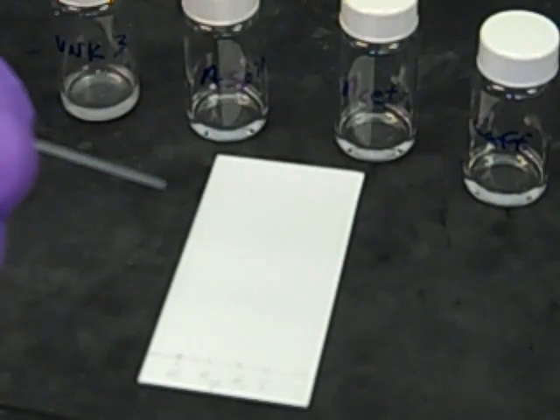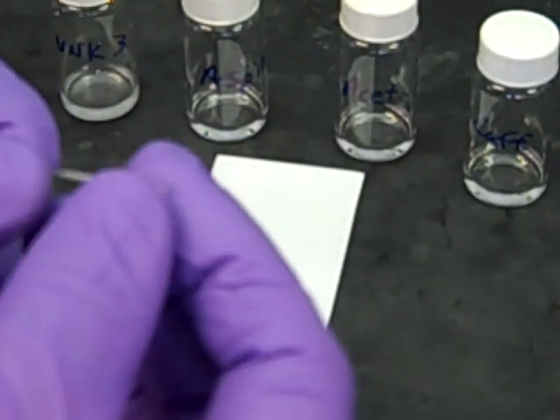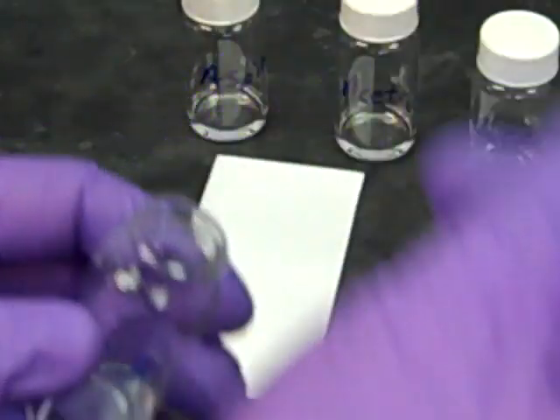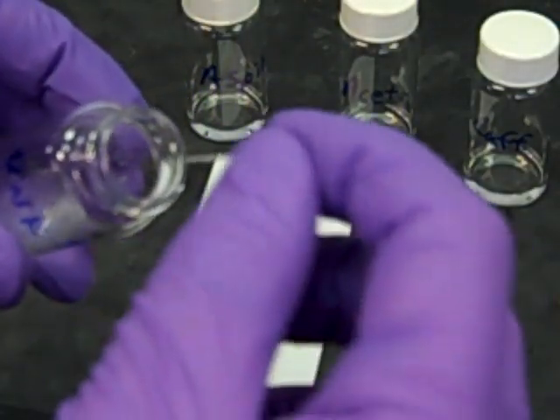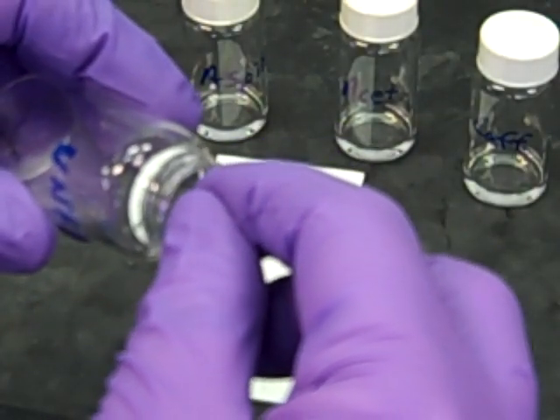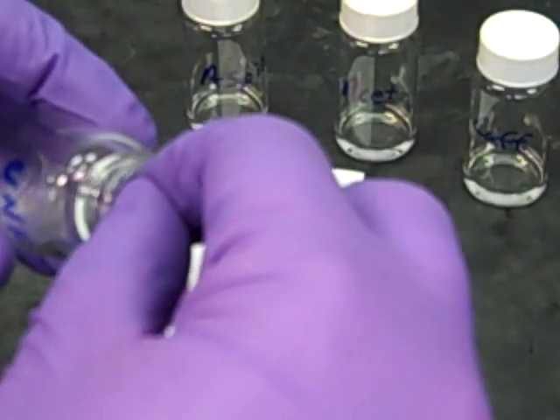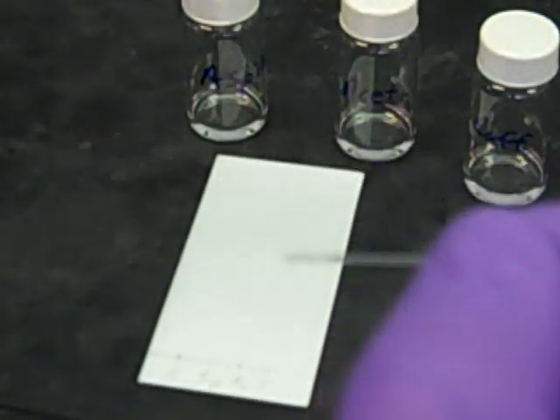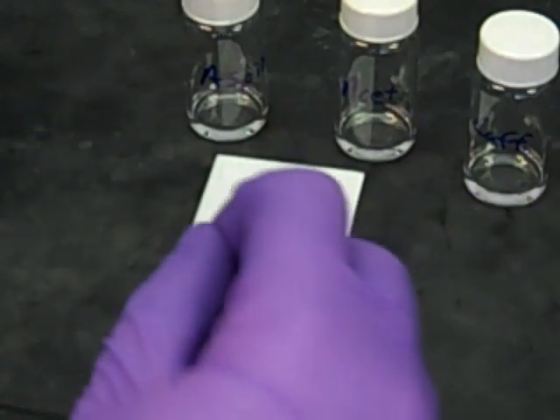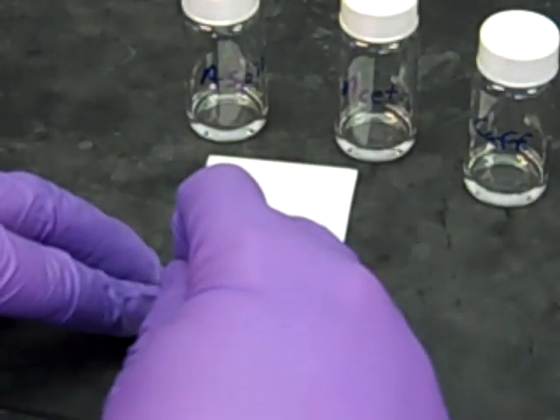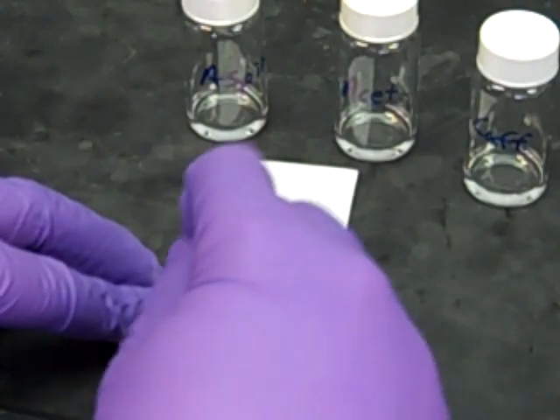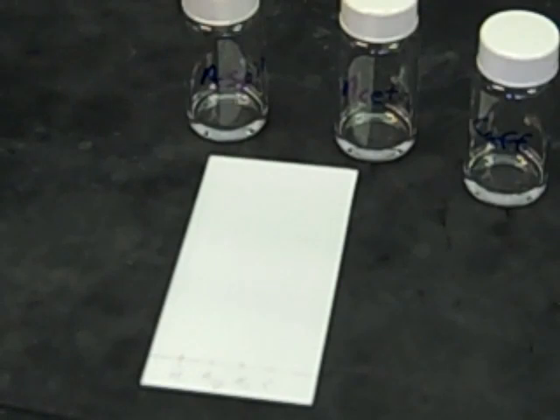These micro capillaries are really tiny and look like this. Take the capillary and dip it into the vial containing, in the first row, our unknown. I'll pick up a little bit of the liquid—you can see it's in the tip there—and then spot it on the hash mark for the unknown. As soon as I put that down, the liquid draws down to the plate.